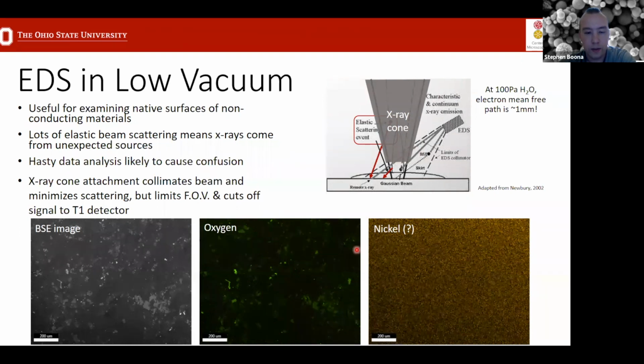And so if you see something like this pop up in your results, that should set off some red flags that this doesn't really seem to correlate with anything in the sample. So I should be suspicious that the nickel signal is actually just an artifact.